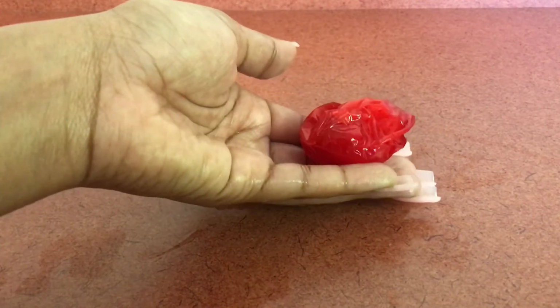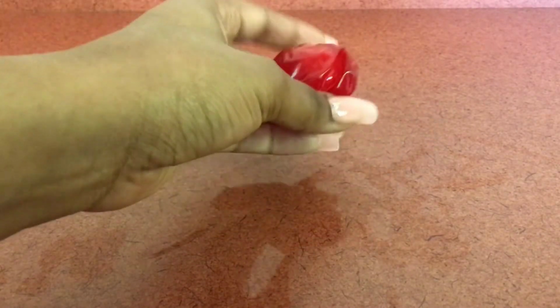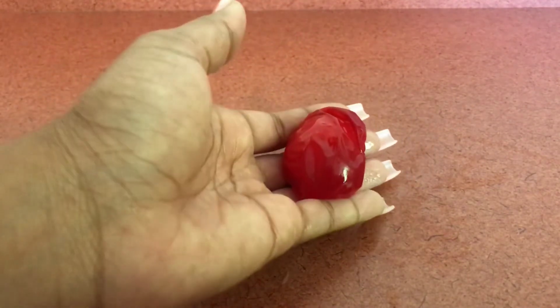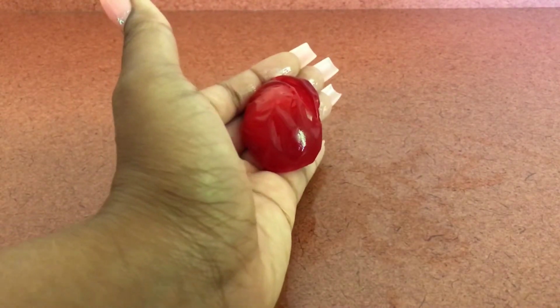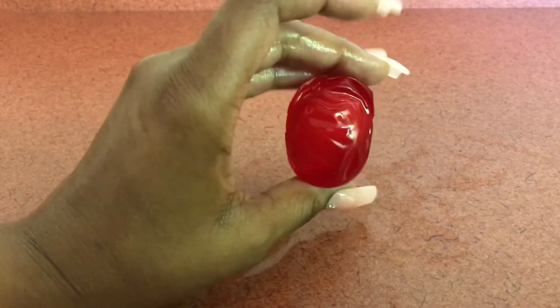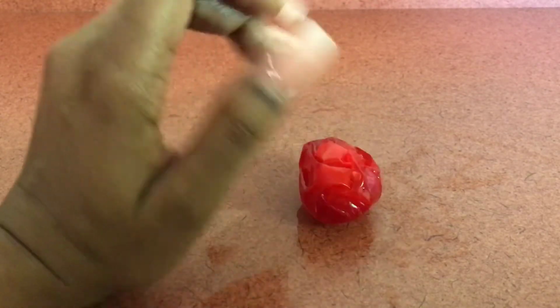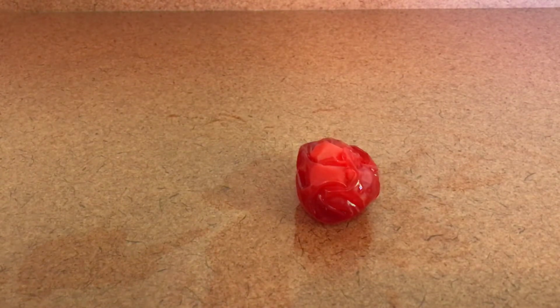It looks like a dried prune, a dried apricot. The outer perimeter is kind of soft, but it's got a little roughness to it. And also our yolk in the center is hard. I tried to squeeze it and nothing happened. It kind of felt like a seed or a rock, kind of.